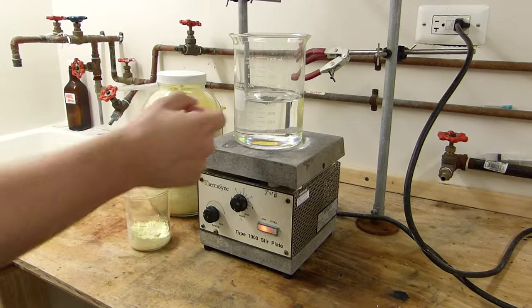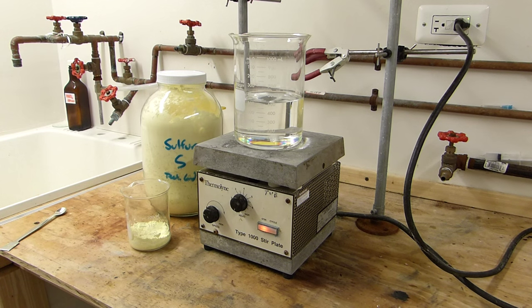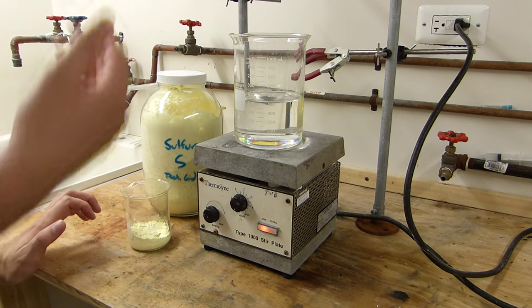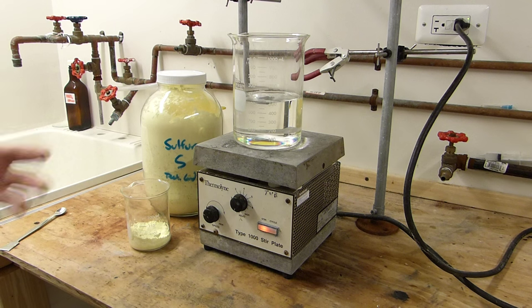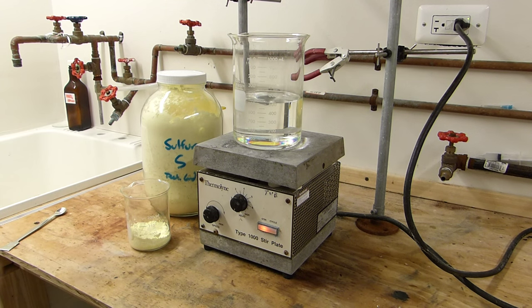So you can find this at the hardware store, and I've got half a liter of it here in this beaker. You're going to want to do this with lots of ventilation because of course this stinks up the place. It's got about the same vapor pressure as water, which isn't too terrible, but that makes it difficult to evaporate later.